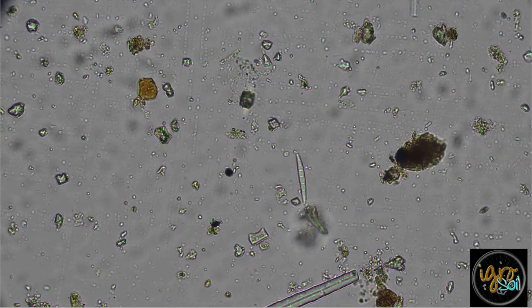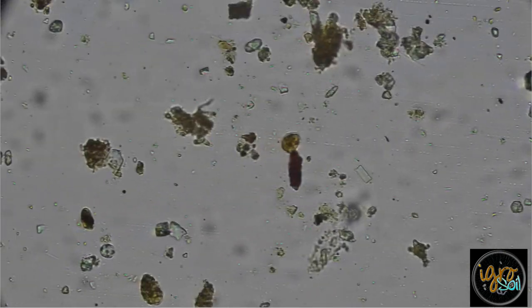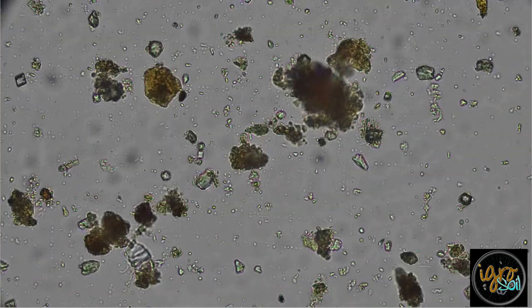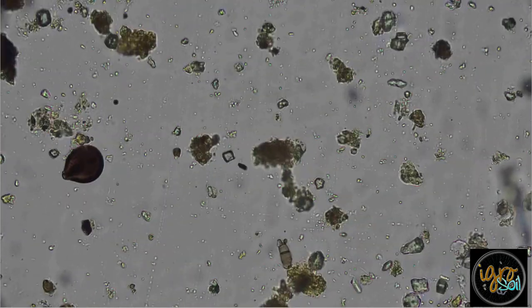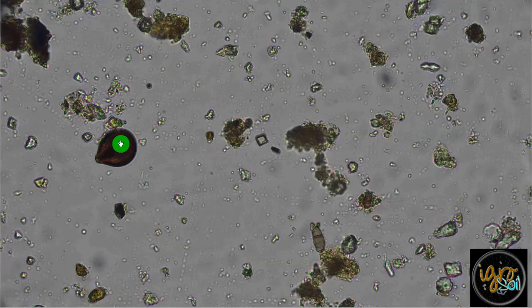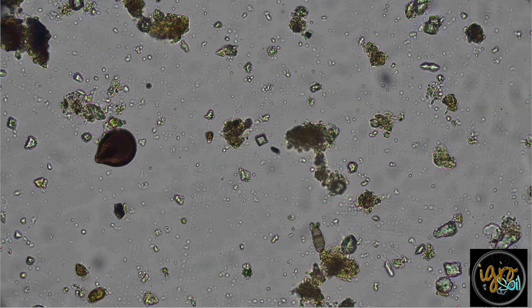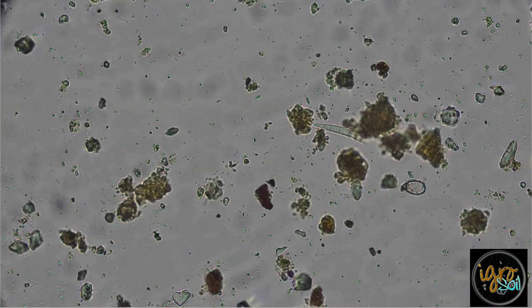So yeah, got to get that addressed. This is why, if I had to guess, and I feel very confident in my guess, first of all, you have no biology in your soil. There's two fungal spores here. That's decent. That's a good thing. But I mean, that and that. There's more Fusarium there.